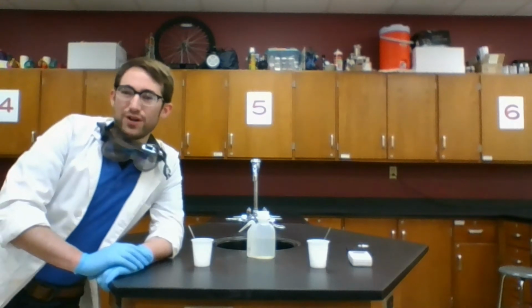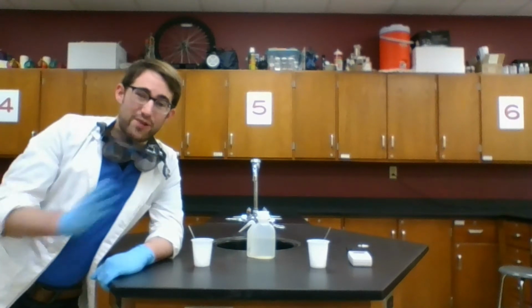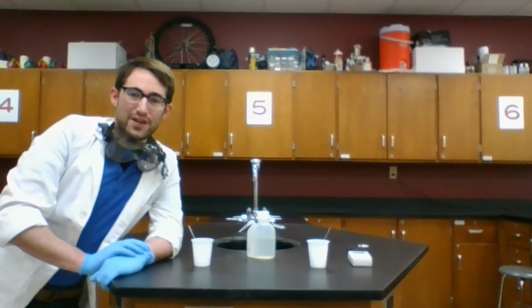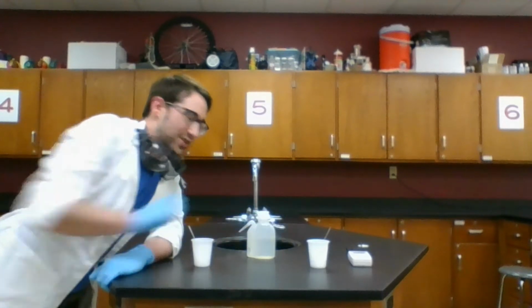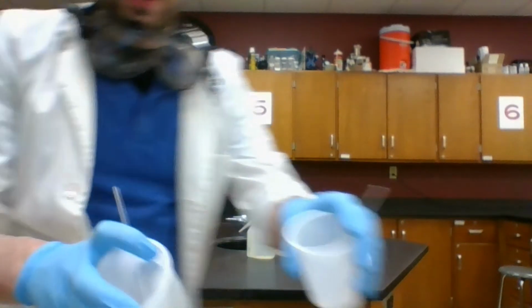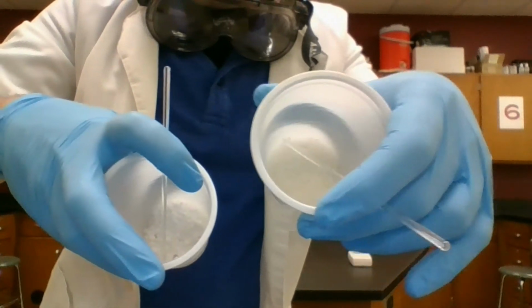So we're going to look at a couple different examples of how we can clue in whether something is a physical or chemical change, starting with these two chemicals right here. This is calcium chloride, and this is ammonium nitrate. They're just in these little cups here. They kind of look like Dippin' Dots. They are not Dippin' Dots, but they kind of look like it.